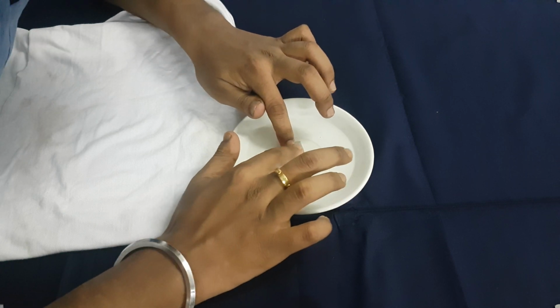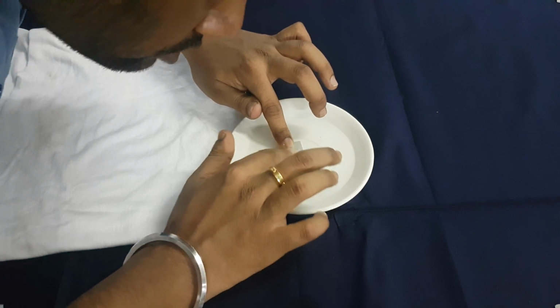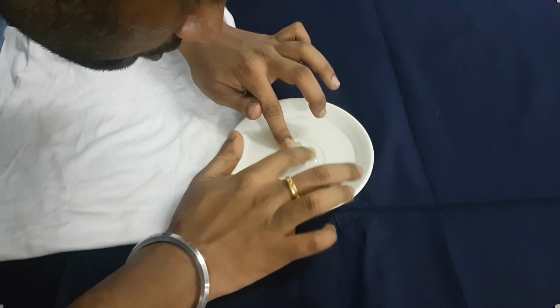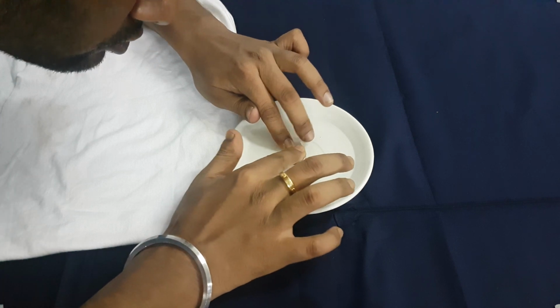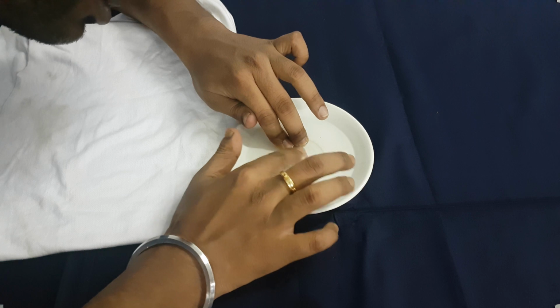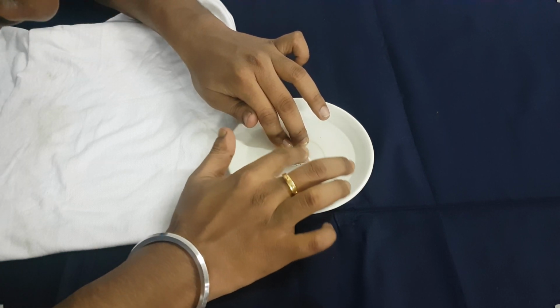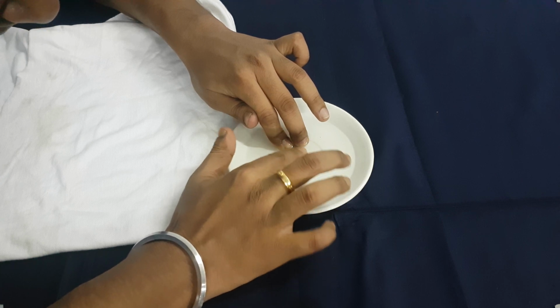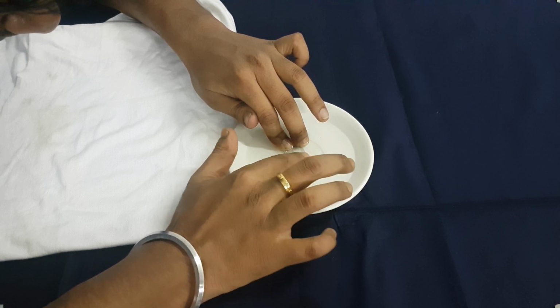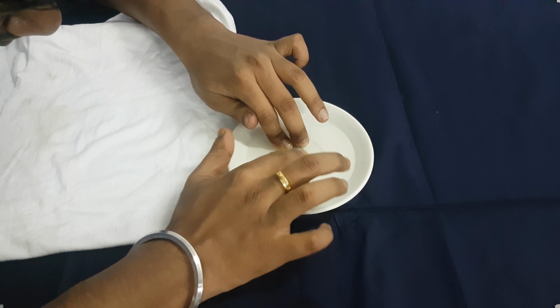Now the wet silicone is soluble in silicone oil. The wet silicone sealant is soluble in silicone oil, but we don't know about the dry silicone.